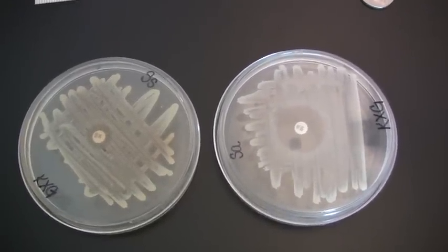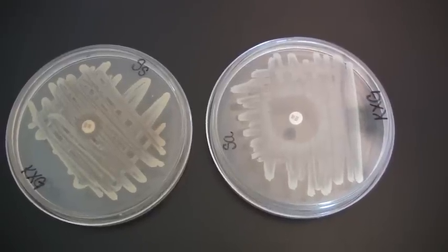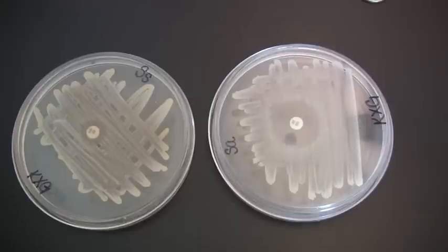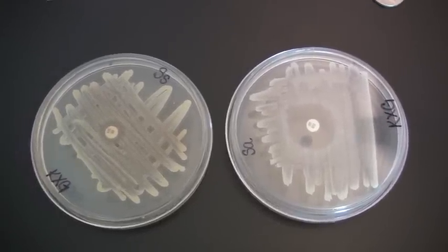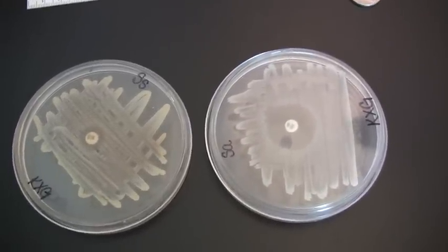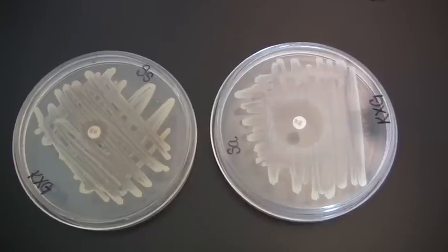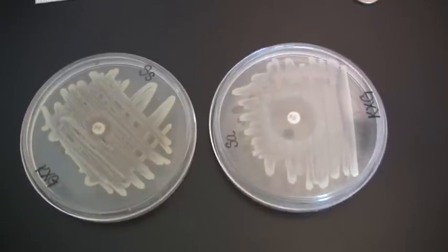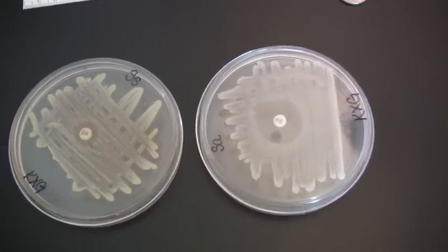So for the Novobiocin antibiotic sensitivity test, we use T-soy, in this example a T-soy agar plate. However, you can use other different media that are out there, and in some instances you can even combine information, maybe by looking at a hemolysis reaction along with antibiotic resistance at the same time. So don't think you're necessarily always locked into a T-soy plate, although you should have a good reason for using a different plate rather than a T-soy plate when completing any antibiotic sensitivity test.